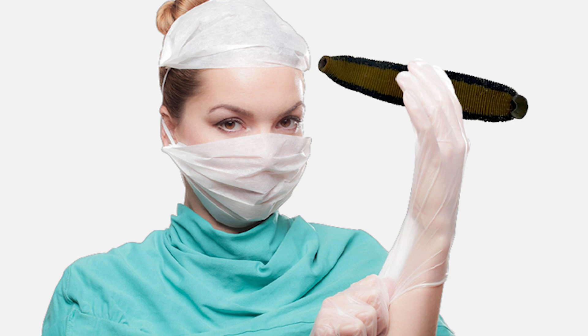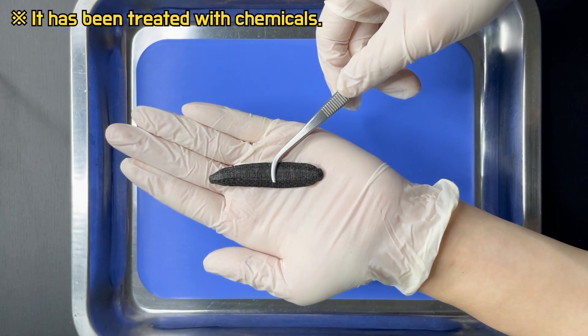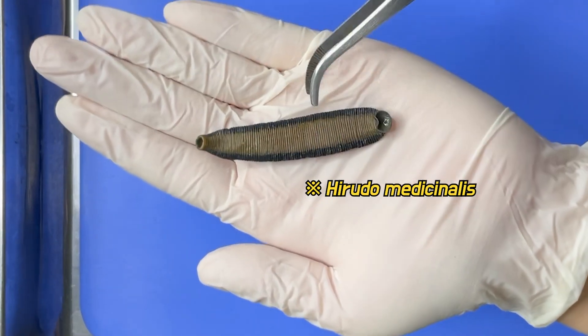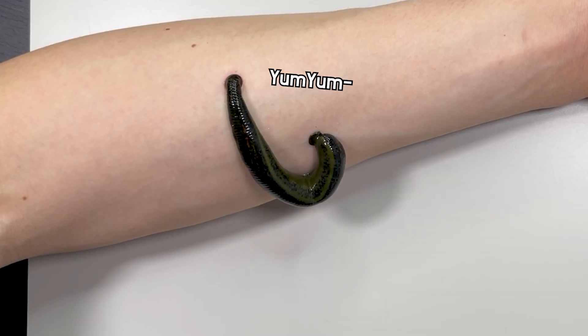Today, let's dissect a leech. This right here is the leech. This leech is used in the treatment of various diseases by bloodletting.